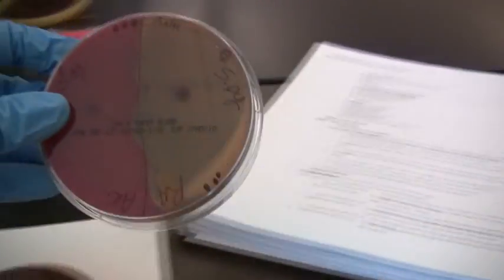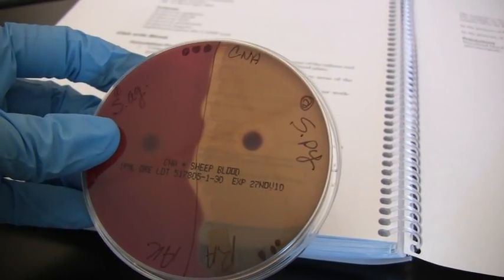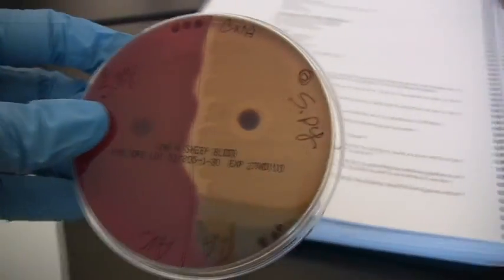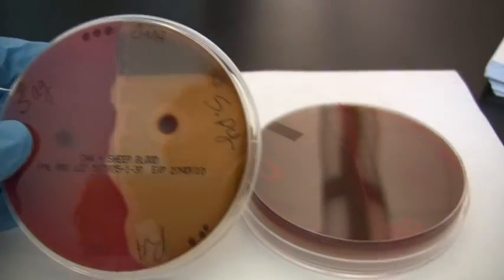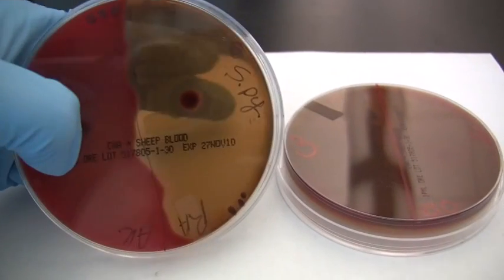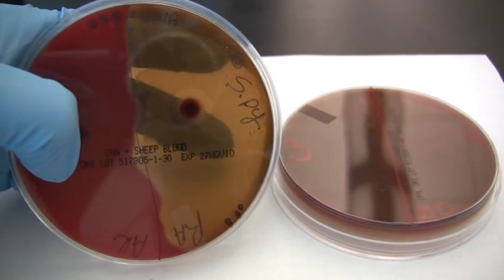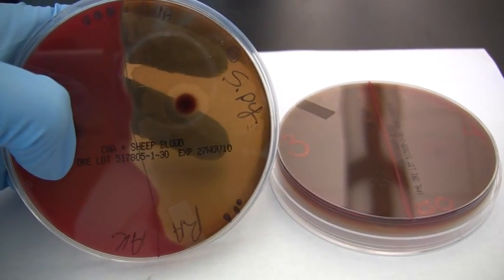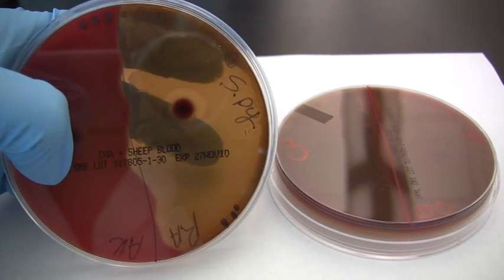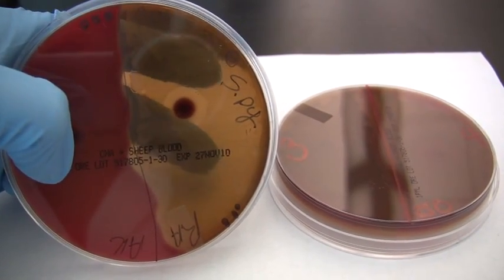And in that case, I tell folks you can pretty much read newsprint through it in most cases, even if there's a tint there, because the blood has been completely broken down. So this on the right here is beta hemolysis. You really can see right through it. Don't focus so much on it being completely clear. Sometimes you see a slight yellowish tint, but you can see here, I can see directly through the back, and that's beta hemolysis.